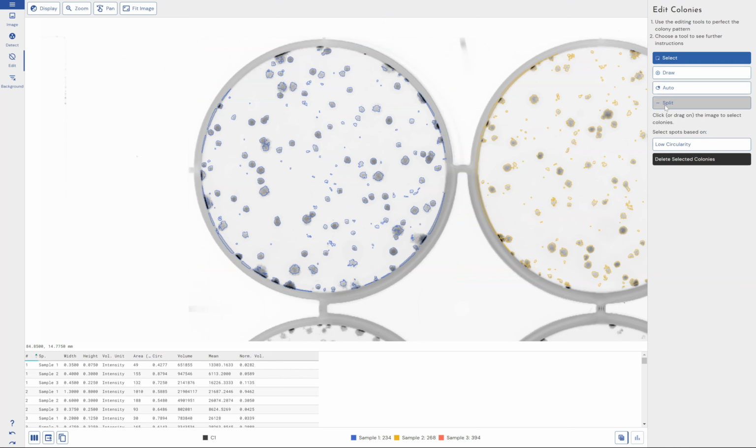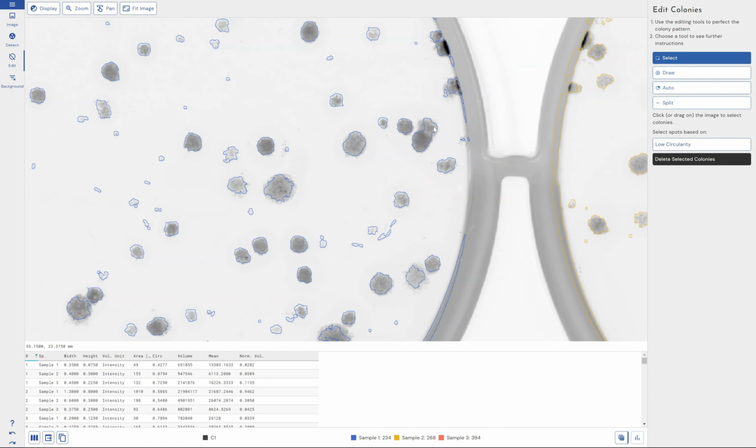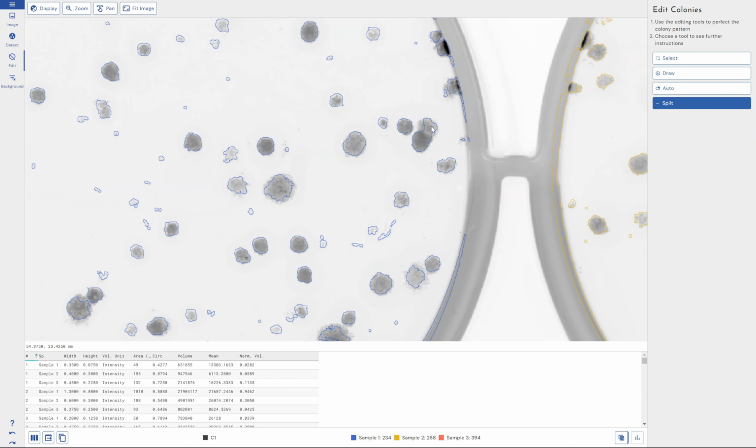If I come down to the edit section, I can zoom in, and those joined up spots that I saw before, what I can do is come across and split them. So you can see here it just lagged a little bit. I've got a lot of tabs open in the background. We can start splitting spots manually. We can draw spots.